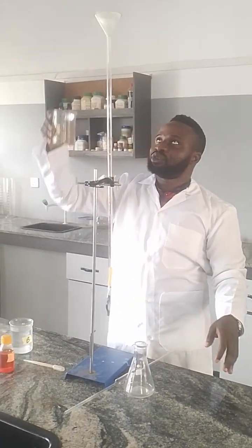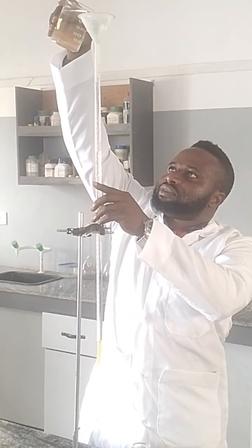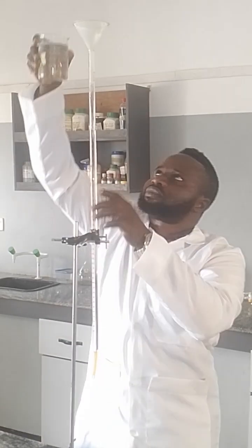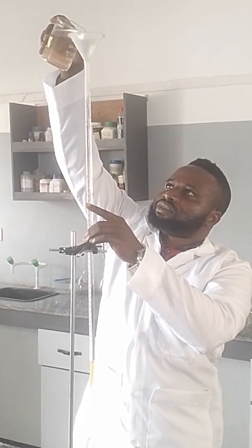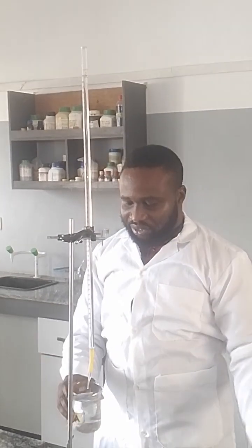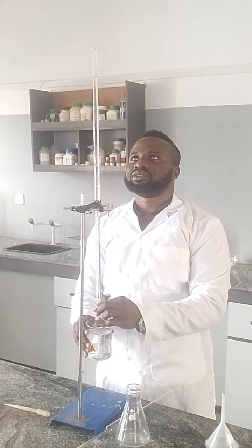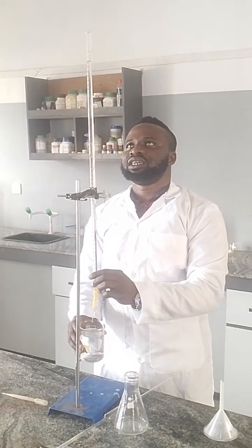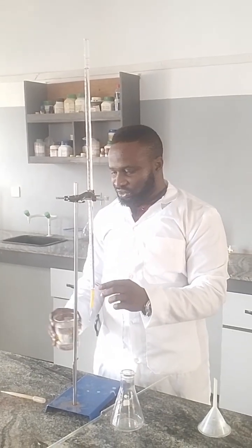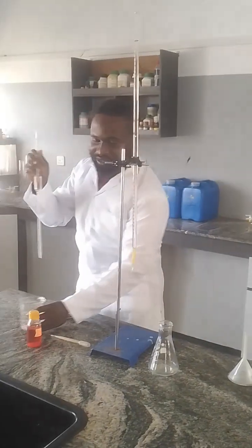Okay, so I'm going to put A inside the burette. It reaches the 0 mark. Now it's a little above the 0 mark, so I'm going to reduce it a bit till it gets to the 0 mark. Yeah, so this is now at the 0 mark, so it has to be the lower meniscus, so it's now at the 0 mark. So I'm going to pipette the B.